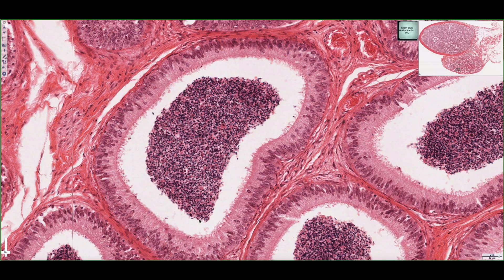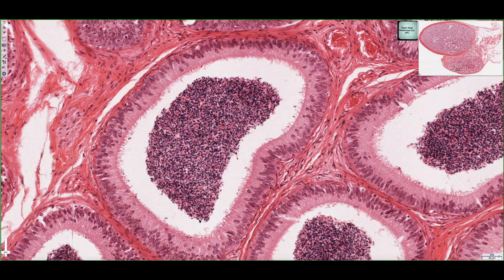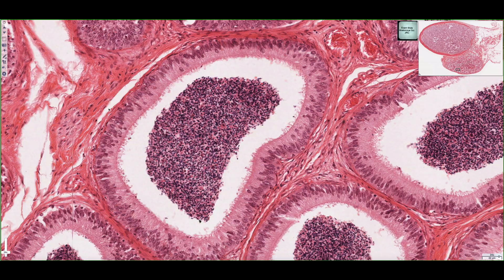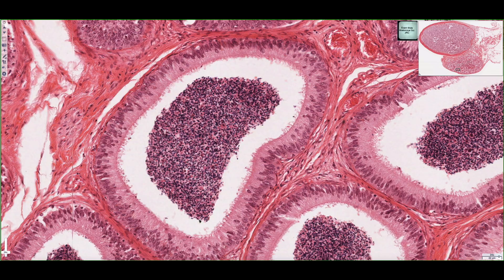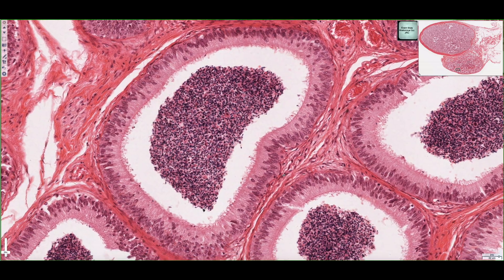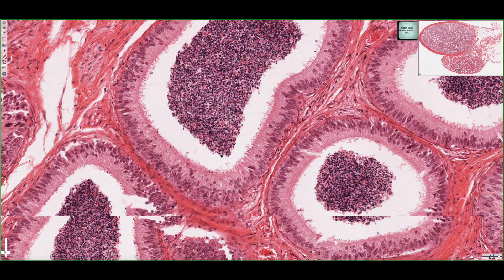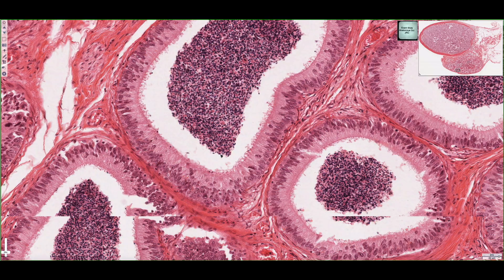In addition, just like the efferent ductules, we have a more robust region of smooth muscle surrounding the entire epididymis, which is going to become continuous with the middle layer of smooth muscle found in the ductus deferens.